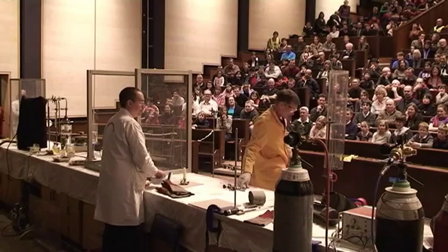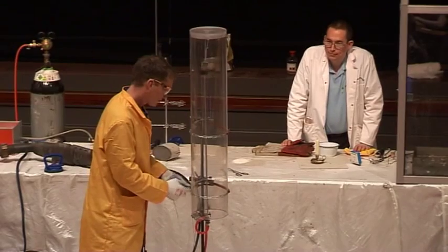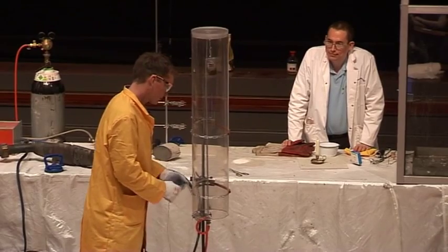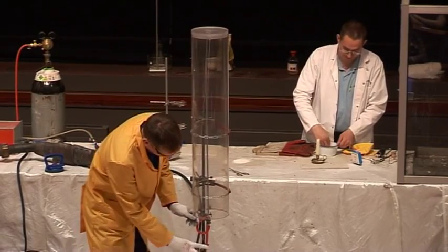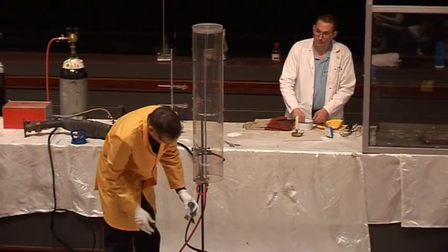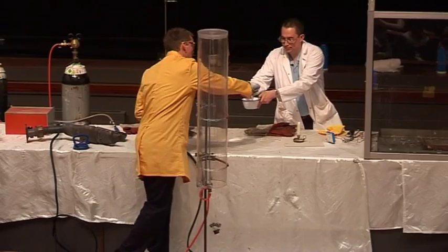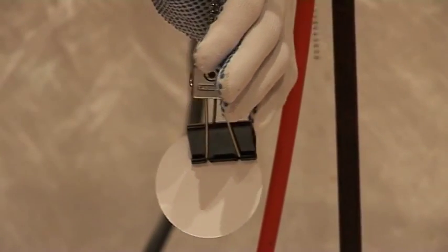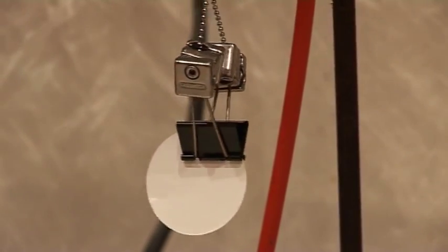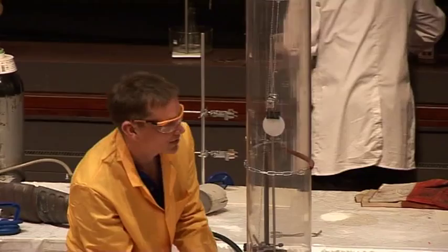Right, I just need to lower the little clamp that we have. Okay, so — piece of paper, soaked in petrol, clamp it in place, raise it up, there we are.